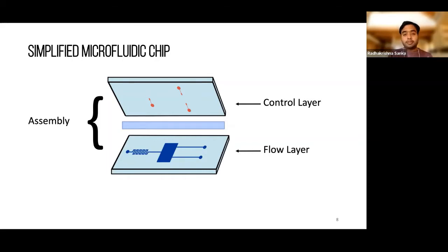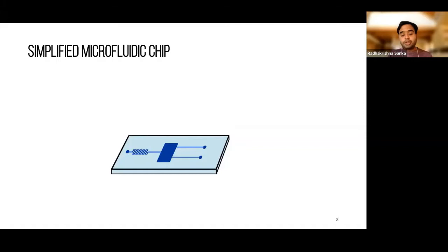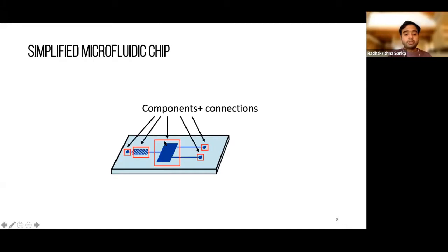Hope that makes sense. I'm happy to elaborate a little more on that if you need. The second thing is, now that we know what the flow layer and control layer are, if we look one level further down, this is how we standardize and think about designs in 3DuF: we break down either the flow or control layer geometries into what we call components, which are the functional units where something will happen. This is just a representative design, but those are specific things that are happening, and whatever they're connected by are what we call connections. So the lines which connect from one component to the other are what we call connections.